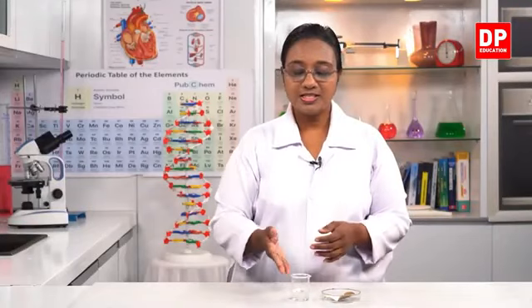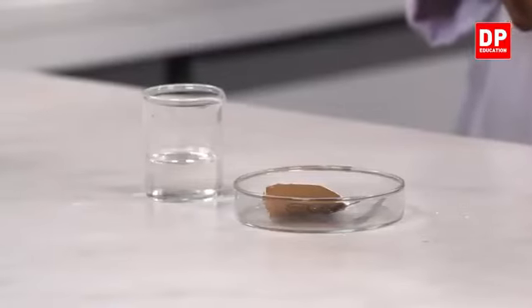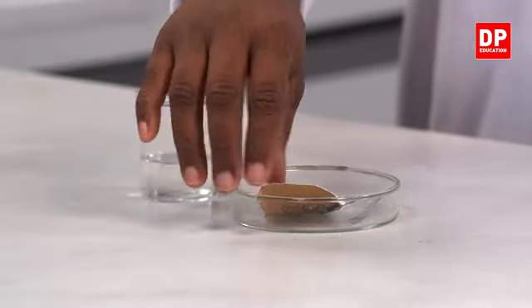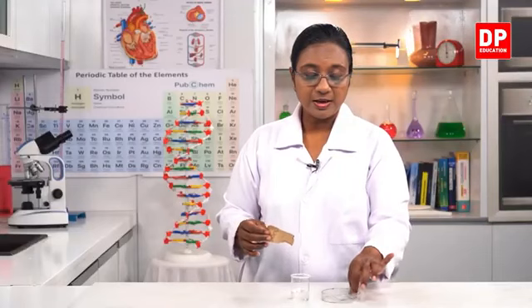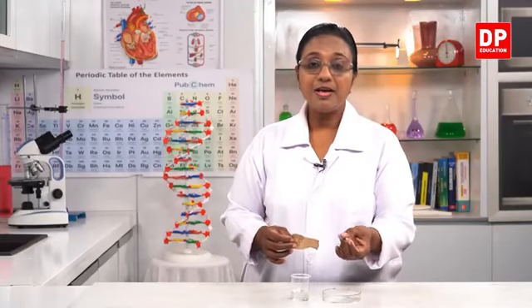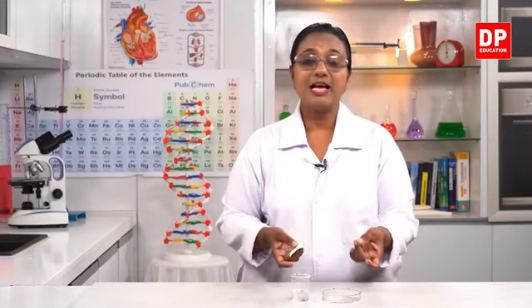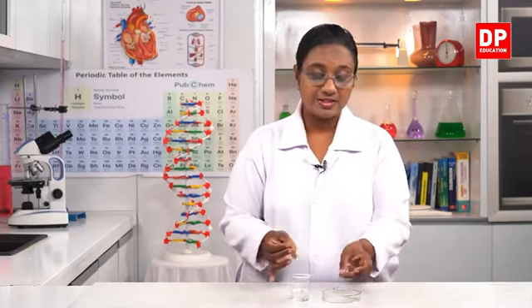So that is the third type of change. Okay students. So the last part of the activity, again we use dilute sulfuric acid and we need a strip of magnesium. So as I told you before also, when you take the magnesium strip from the lab, usually it is either coated in black color or white color layer. That's the oxide layer. We need to clean it with a sandpaper.